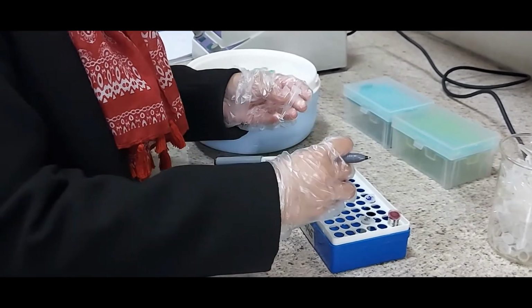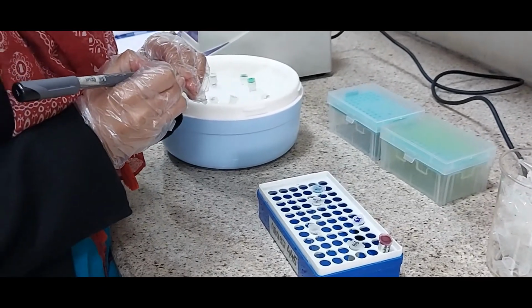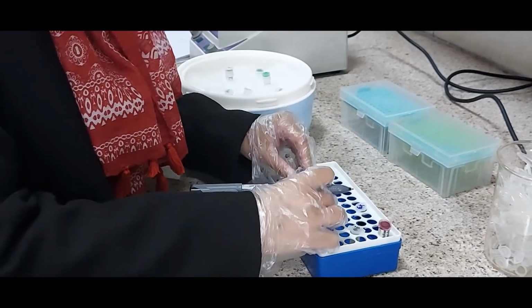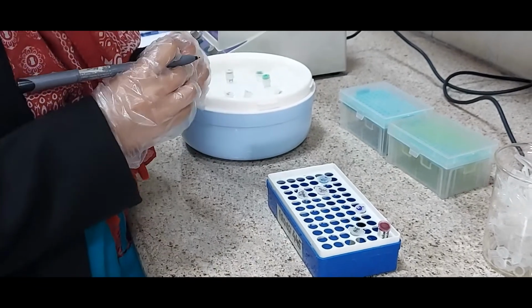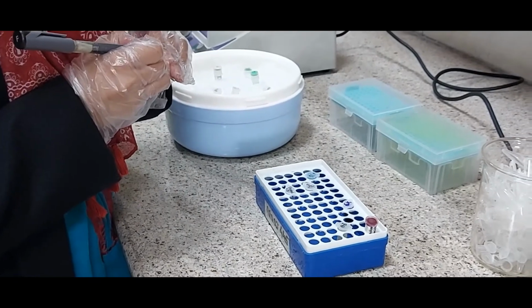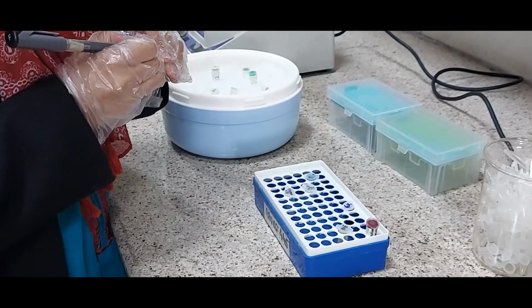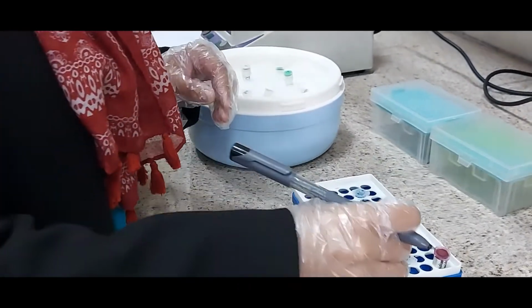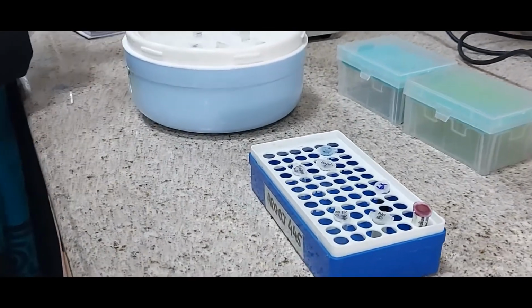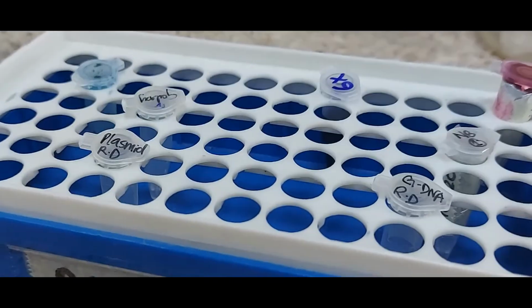Now she is labeling the tubes before we set up the restriction digestion. So we will be performing restriction digestions in 2 tubes. In one of the tubes we will carry the plasmid for restriction digestion, and in the second one we will take the chromosomal DNA, that is the total genomic DNA from wheat. So she can label them like plasmid and genomic DNA, or she can simply label them tube 1 and 2, but keep the record.